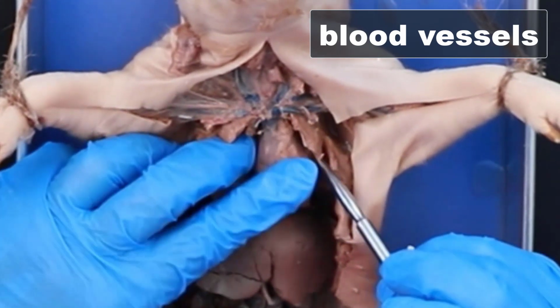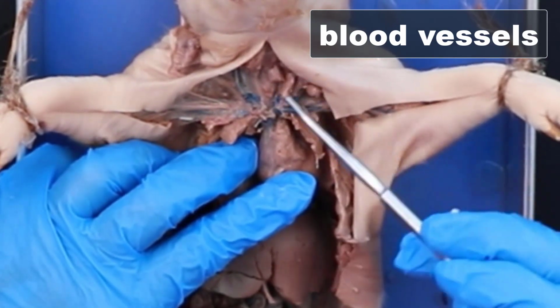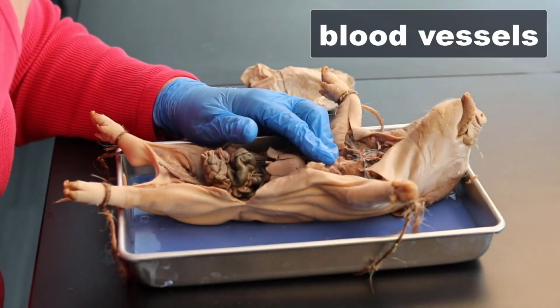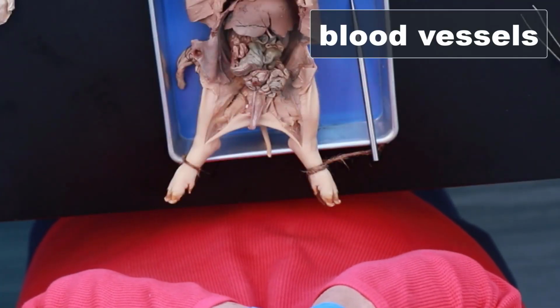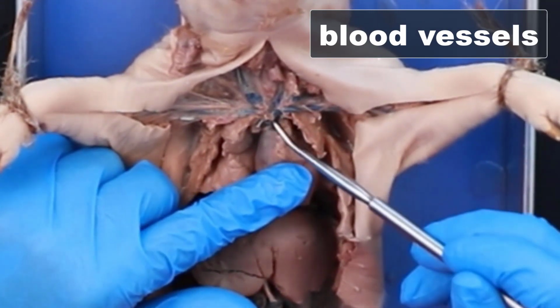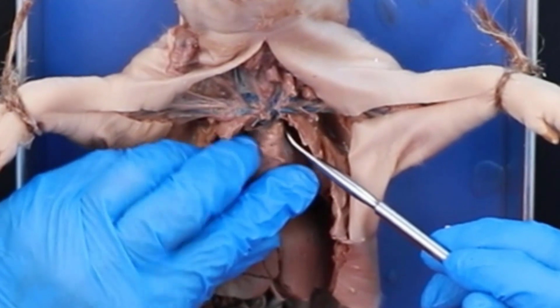But you can see here is the superior vena cava. You're coming in here, the blue here on the side of the neck, these are the jugulars, and going across here, it would be right where your clavicle is, so those are the subclavians. So you come up and split like this, and everything is draining just like this, draining into the heart.